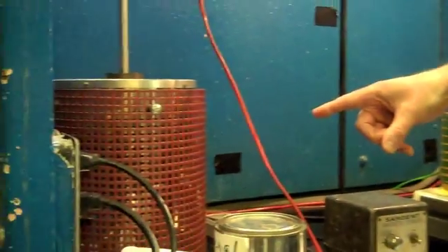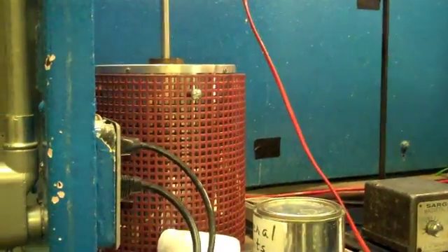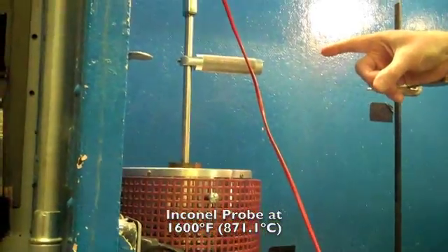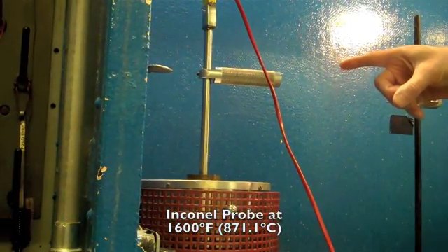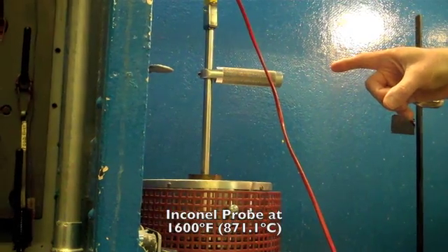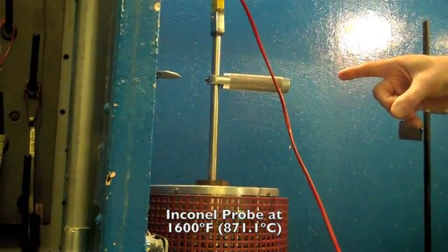Over here, we have our furnace with the Inconel probe inserted into the furnace. We heat the probe up to a standard temperature of 1600 degrees Fahrenheit or 871.1 Celsius.